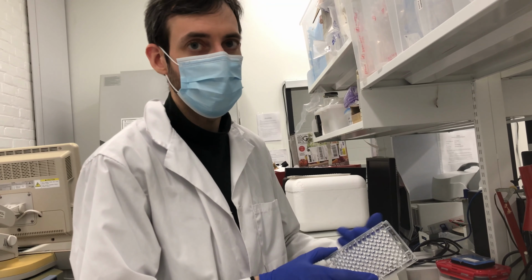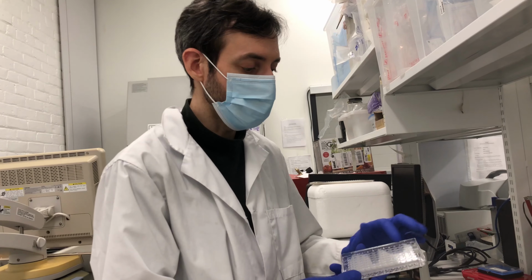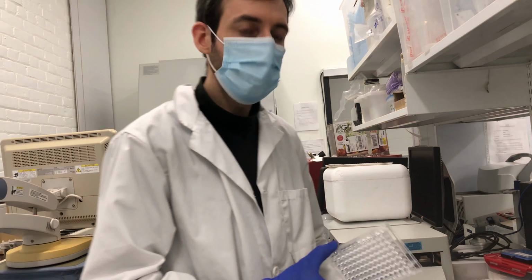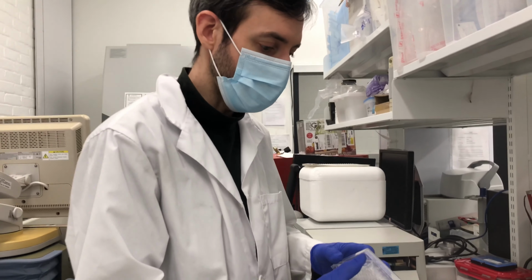And then there's some other small variations of how the bottom looks like. It could be clear bottom or opaque. Okay. So those are all the tips I have for today.